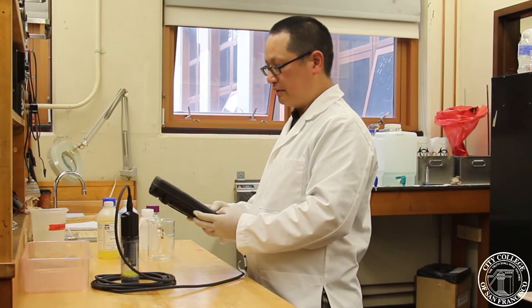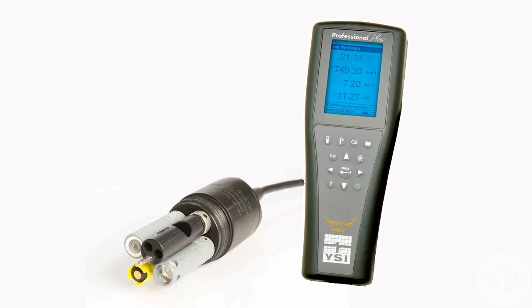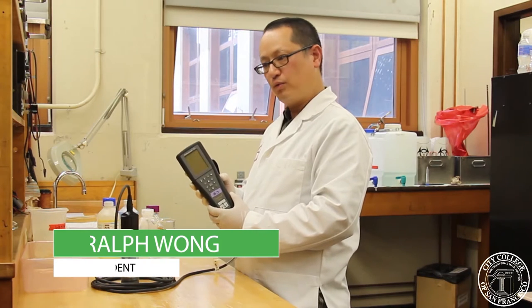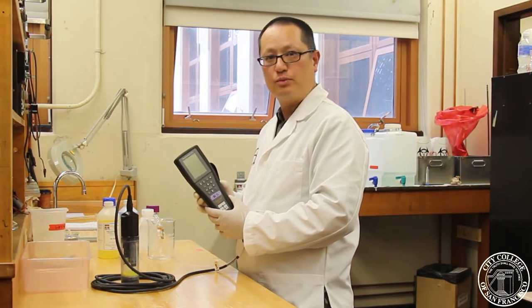Hi, today we're going to be calibrating pH on the YSI Professional Plus Meter, and the purpose of that is to make sure we have it properly calibrated every day before we go out to the field. And pH is important in determining water quality.